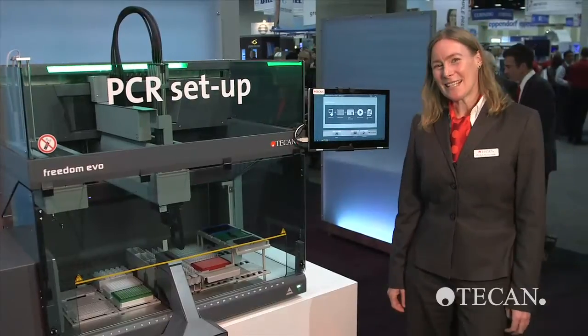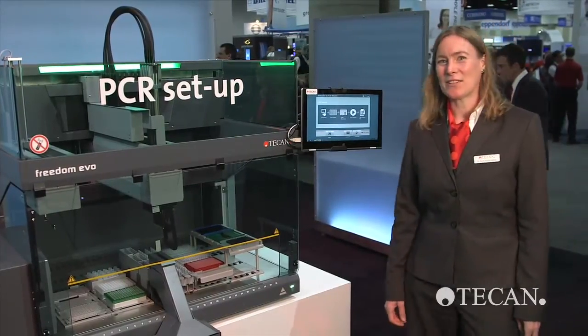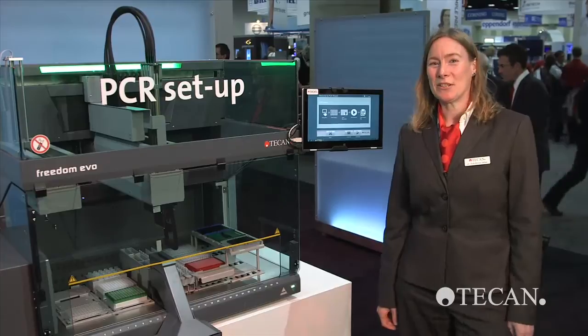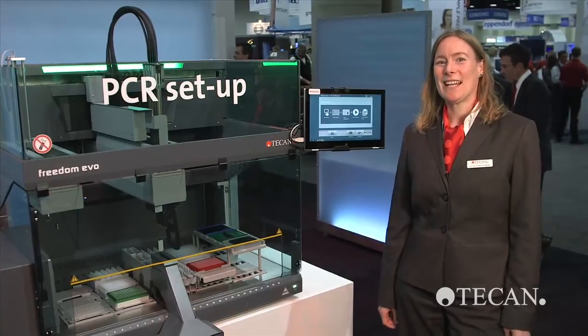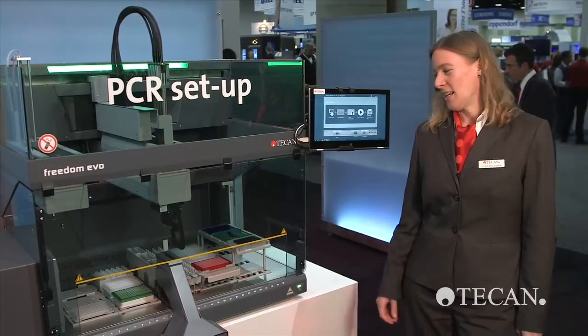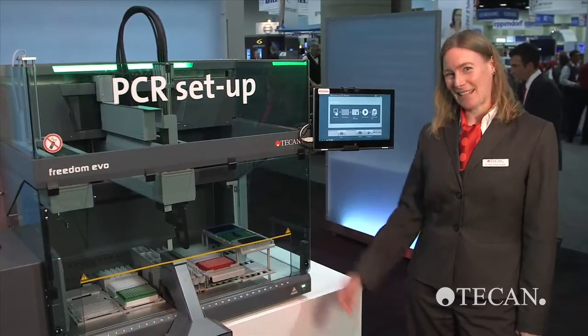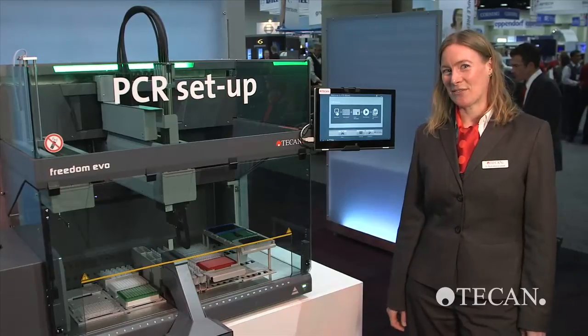What we took really care of is designing the software to be exceptionally user-friendly. We guide the operator throughout the setup step-by-step to a successful run.